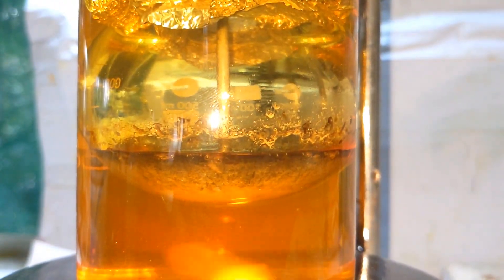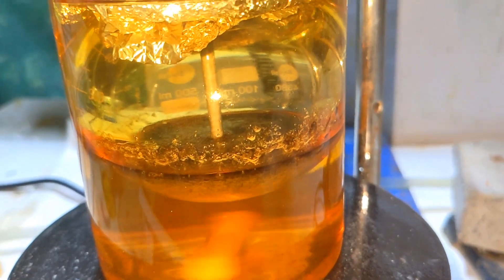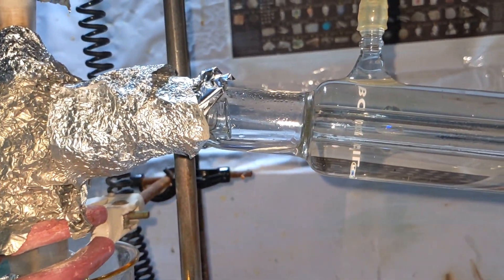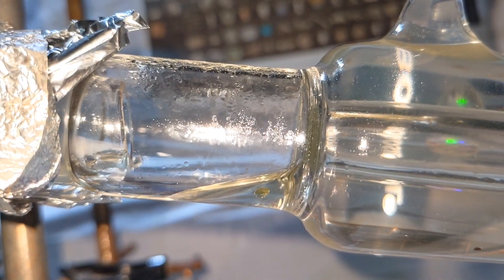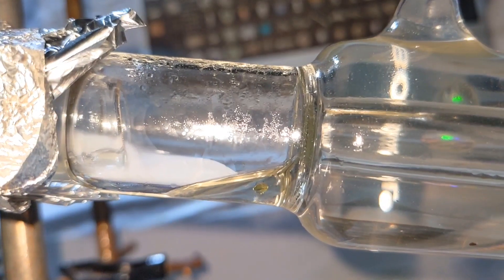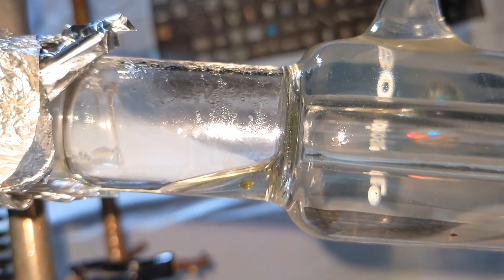The temperature should be strictly at 290 to 295 degrees Celsius and not more than that, because if the temperature goes above 300 degrees Celsius, the reactant adipic acid starts to distill over and clogs the condenser. When the temperature reaches 295 degrees Celsius, you can see vapors of cyclopentanone traveling down from the distilling head into the condenser and condensing as liquid.